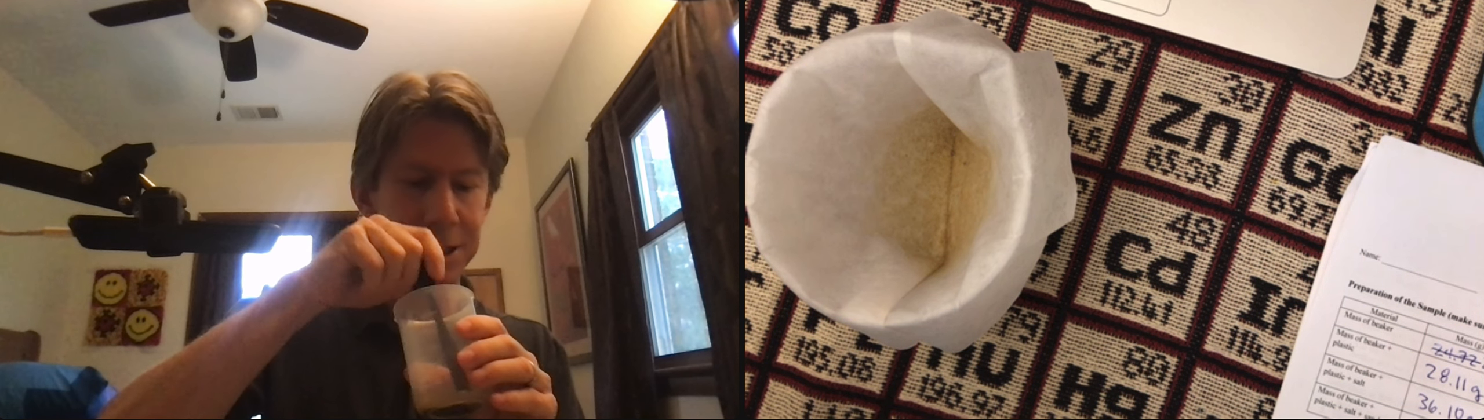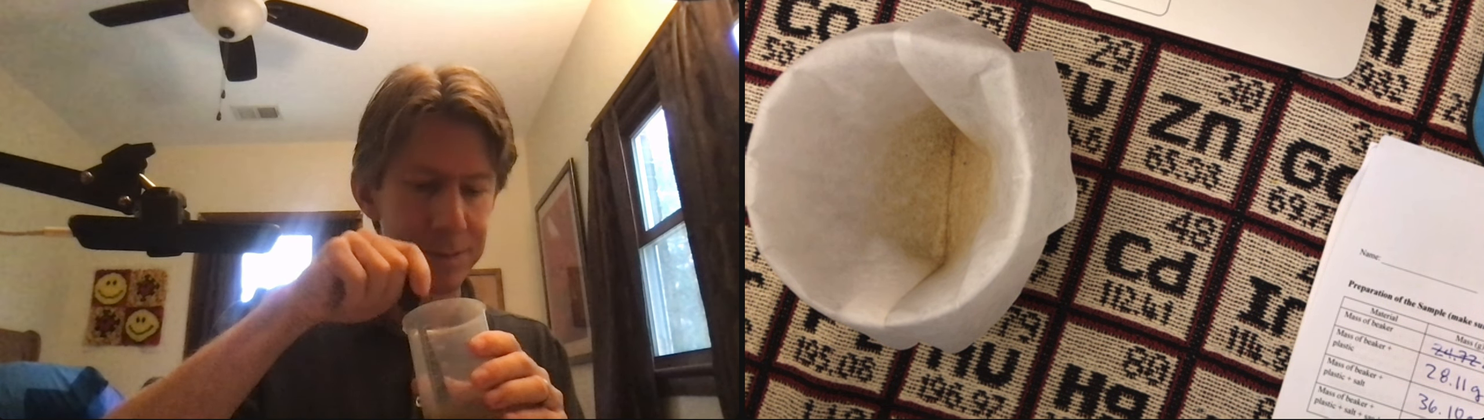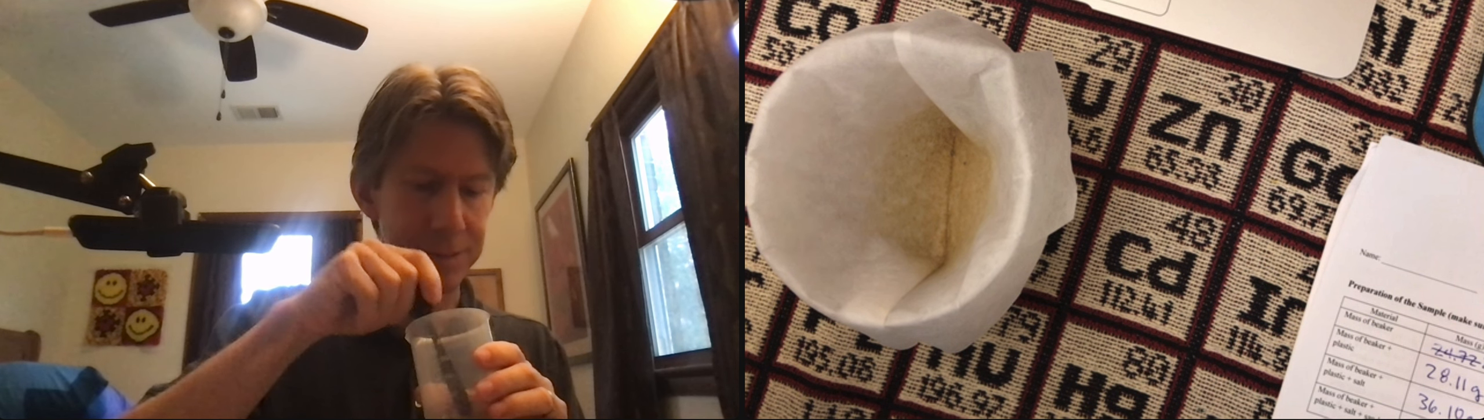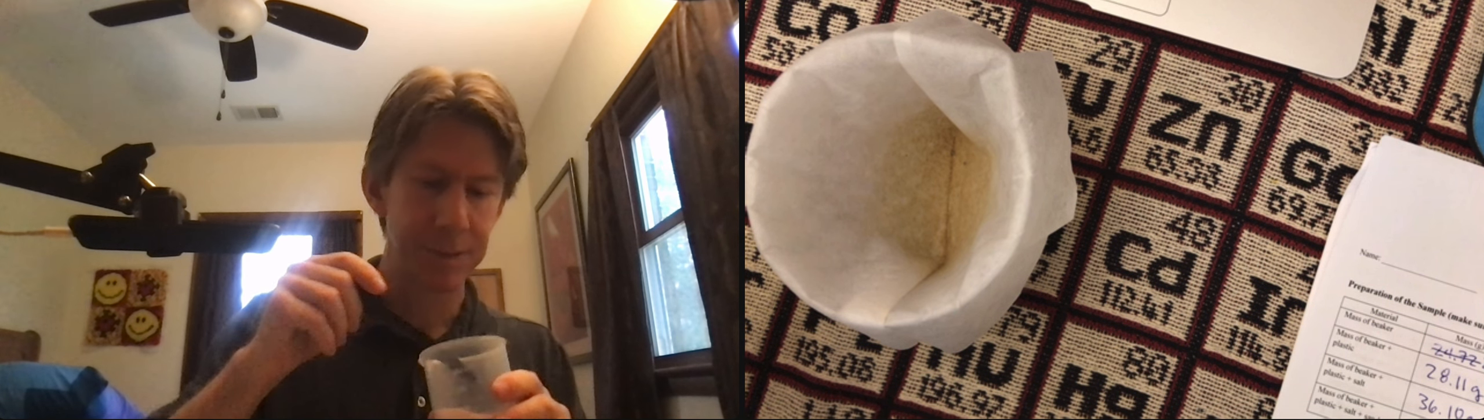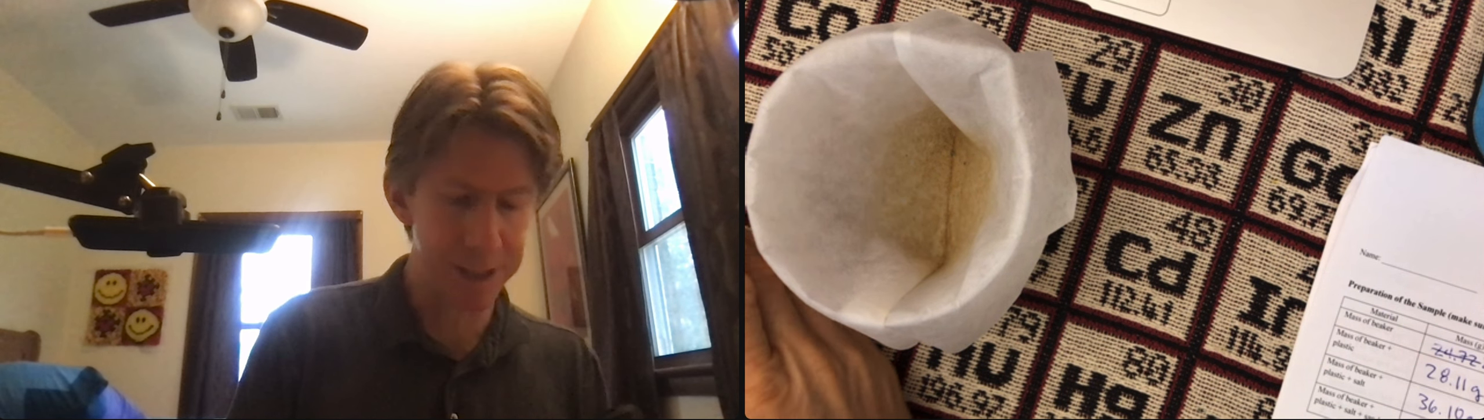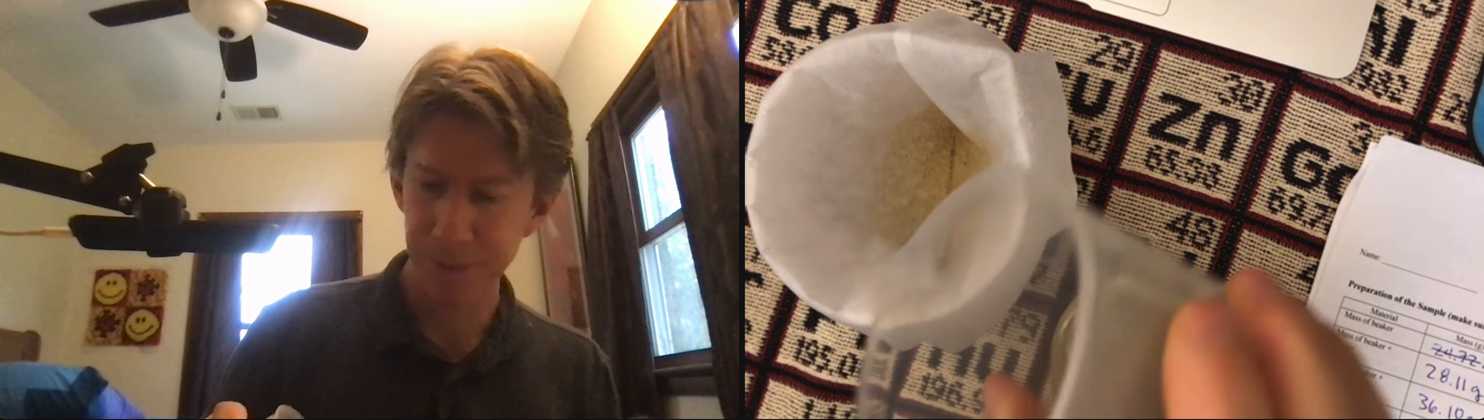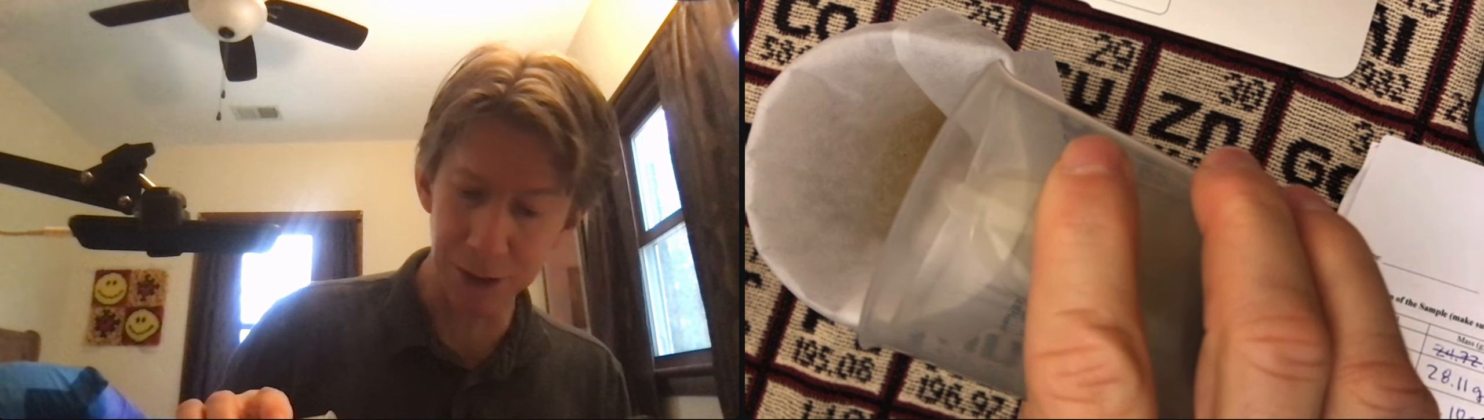So I'm mixing. And then I'm going to pour it through. And it's okay if lots of sand is left as long as there's no salt left.